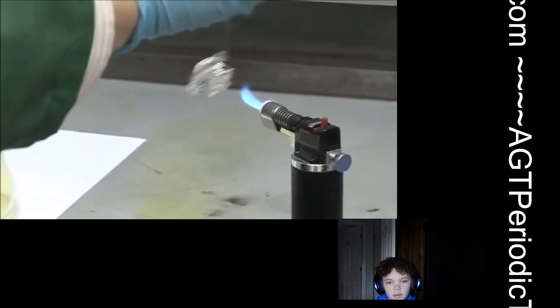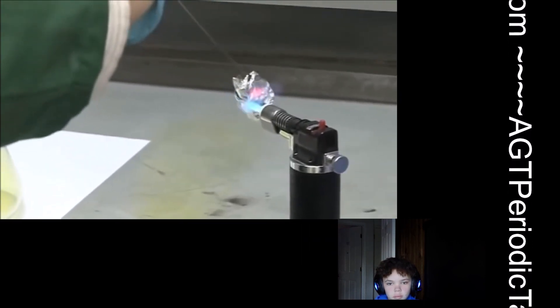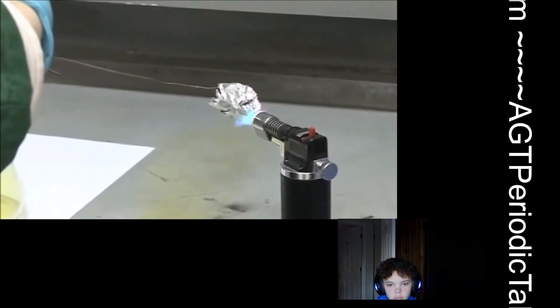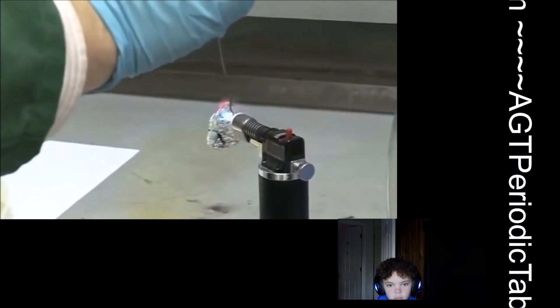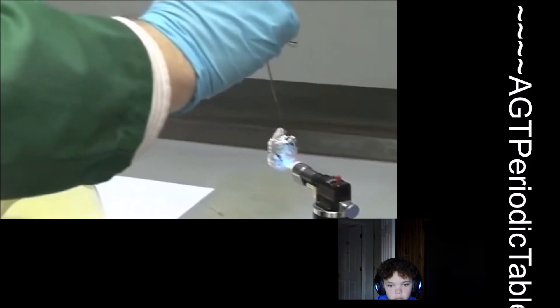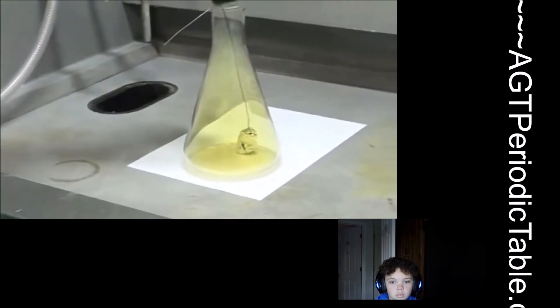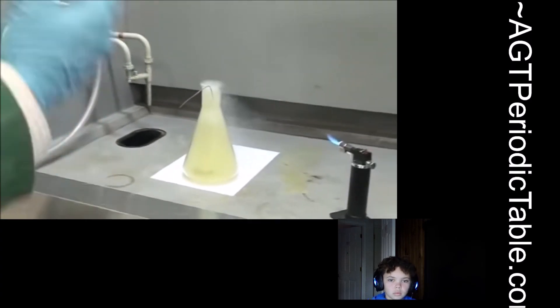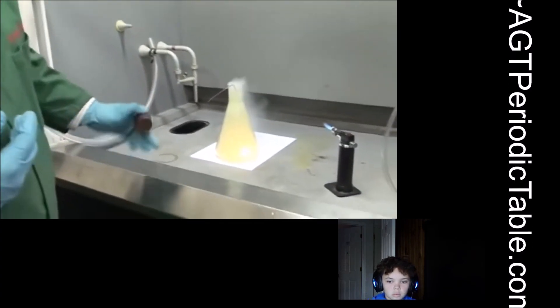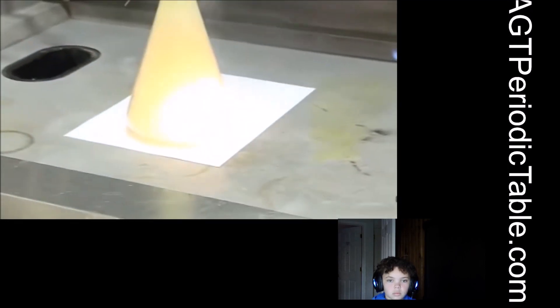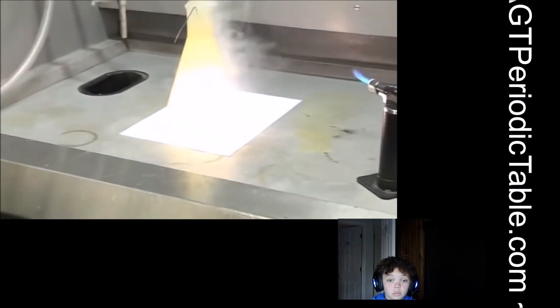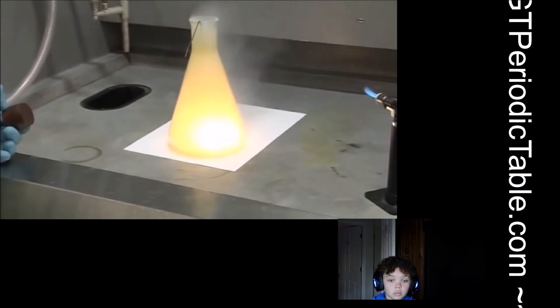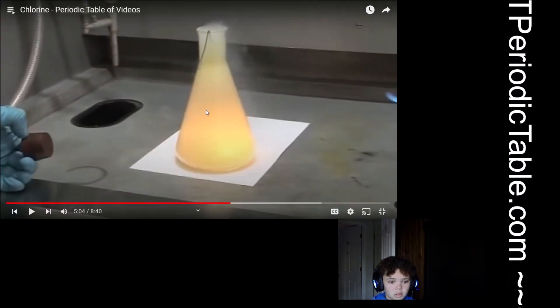So, let's heat up our aluminium. OK, so it's nice and warm, all over. And then we'll drop it, we'll add it into the chlorine flask. Now instantly we're seeing aluminium trichloride coming out of the top and reacting with moisture in the air. So now you can see that the reaction is getting very intense and we're seeing a flame in the bottom. So the aluminium is being consumed as it's reacting, oxidising strongly in that chlorine rich air. That's insane.